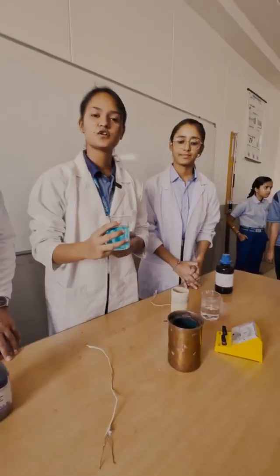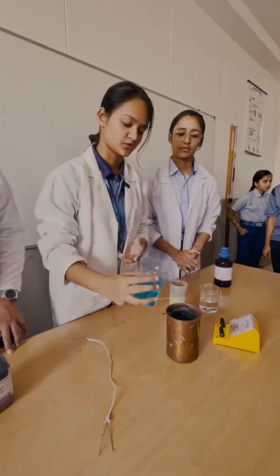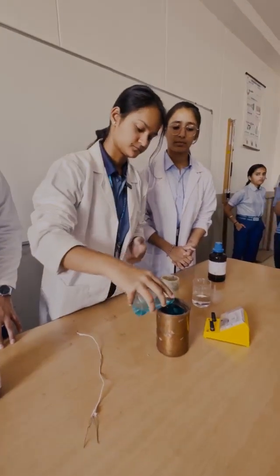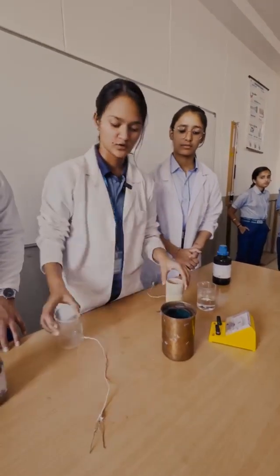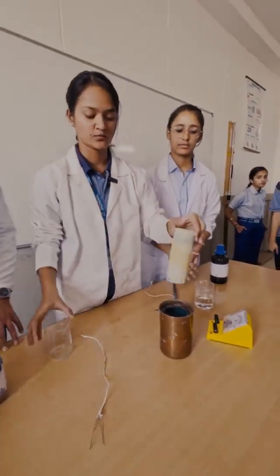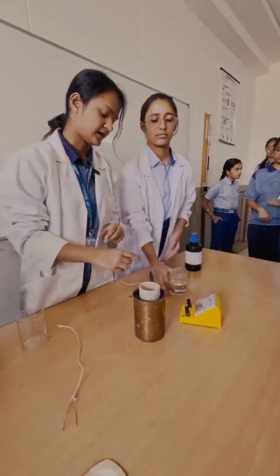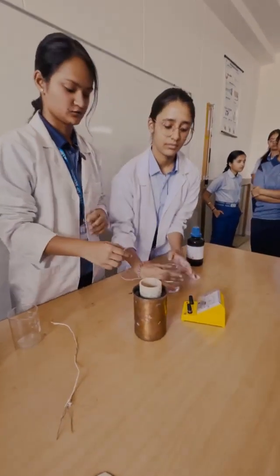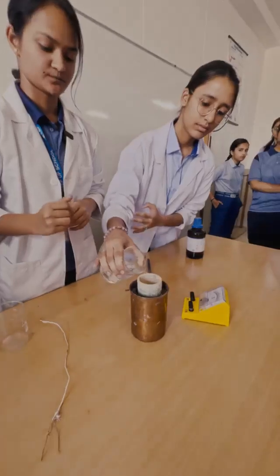Now we are going to pour this copper sulphate solution into the copper vessel. Then we are going to put this porous pot in the copper vessel and add sulphuric acid to the porous pot.